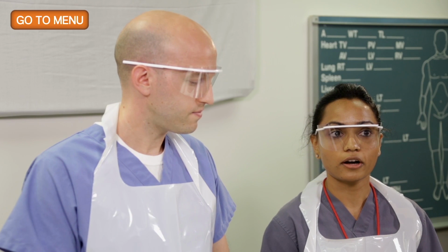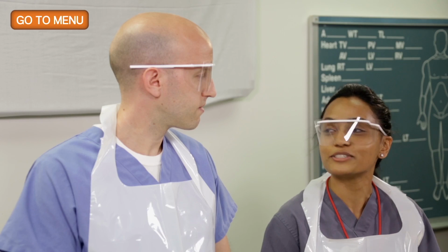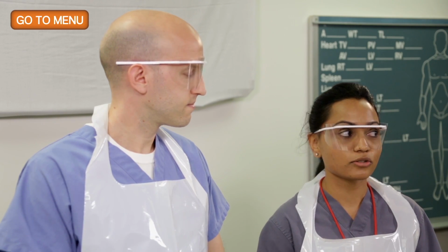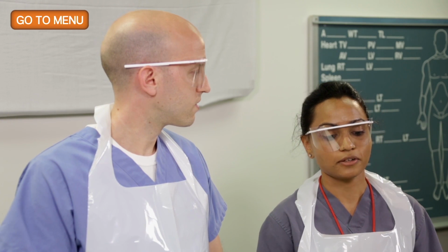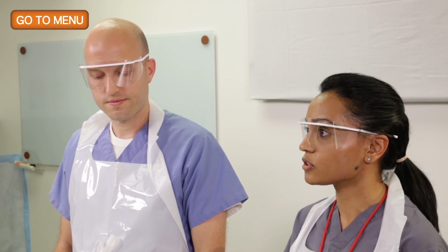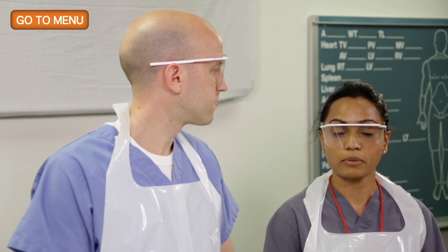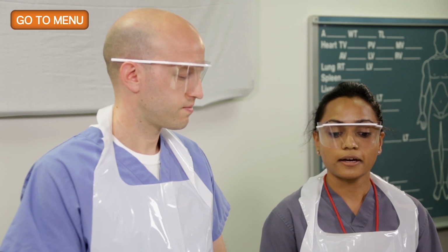Secondly, we look for the major branches coming off of the aorta, so the brachiocephalic trunk and the left carotid and then the left subclavian. We also look to see if there are any coarctations present. One of the big differences is that we dissect the pediatric heart according to blood flow, and that's to look for septal defects. And then lastly, for pediatric hearts, we look for the patency of the foramen ovale and also the ductus arteriosus.